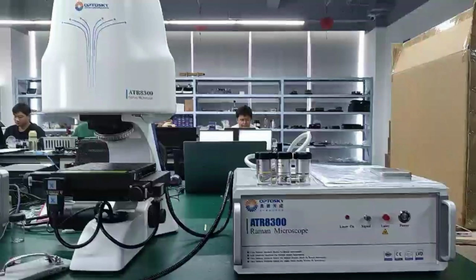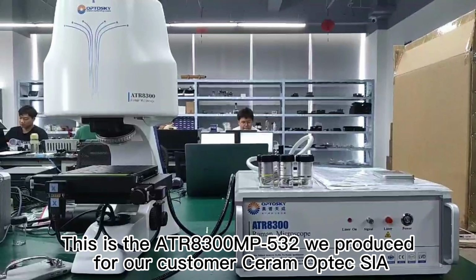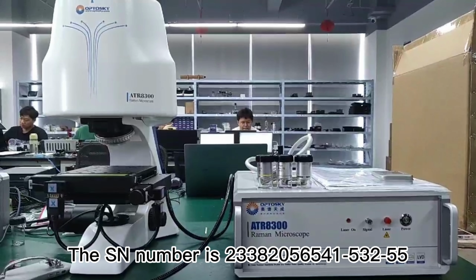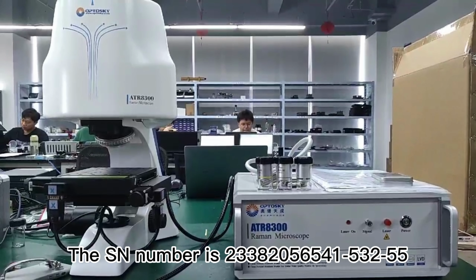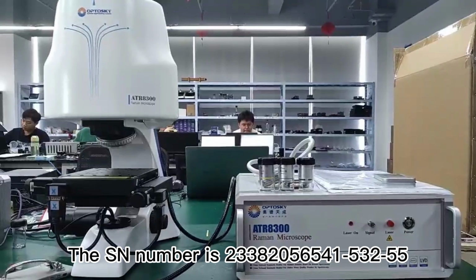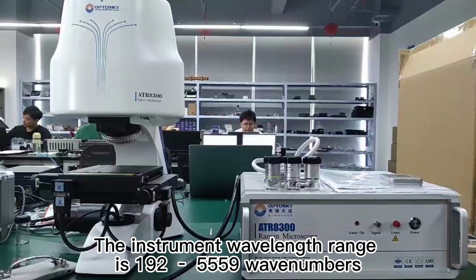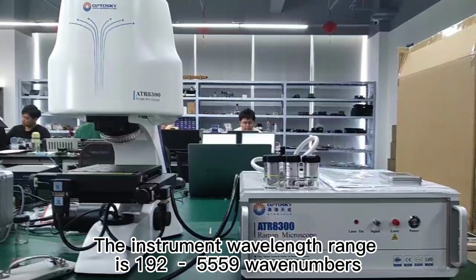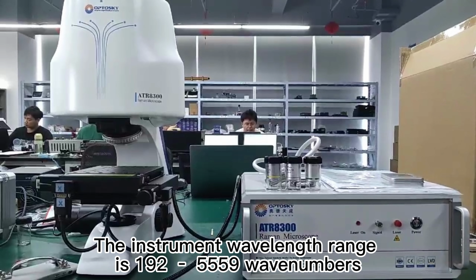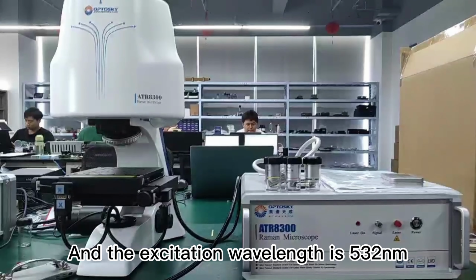Hello everyone. This is the ATR8300 MP532 we produced for our customer Serum Optech SIA. The SN number is 23382056541-532-55. This device has functions such as autofocus, autoscan, and Raman imaging. The instrument wavelength range is 192 to 5559 wave numbers. And the excitation wavelength is 532 nanometers.